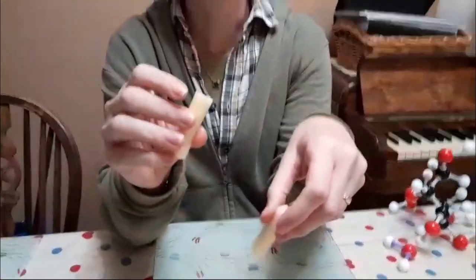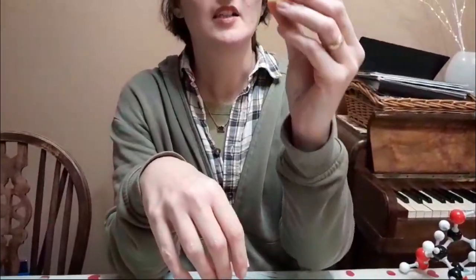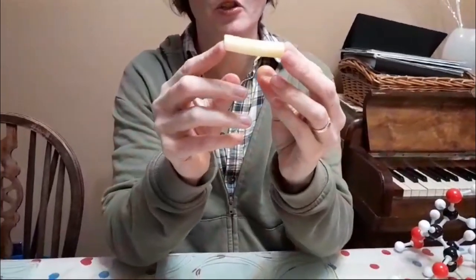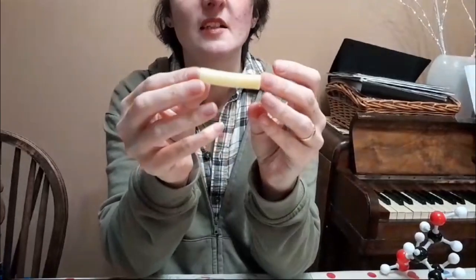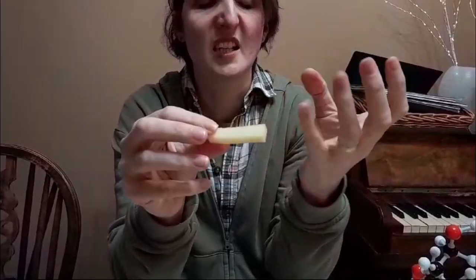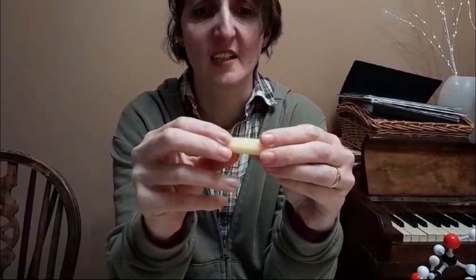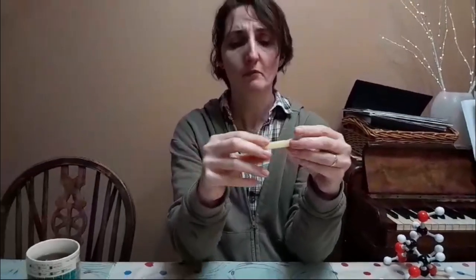So we've got hypotonic. Hypotonic, it's a high water concentration. The cells get bigger. Hypertonic, low water concentration. Look at it, it's bending inwards as well. The cells, they can't quite shrink, but they get flaccid. The cells get smaller. The cell walls stay roughly the same size, but the cells inside them shrink a little bit. They are flaccid. They are easier to bend, floppy. So there we go.